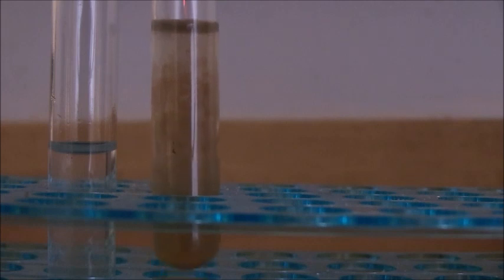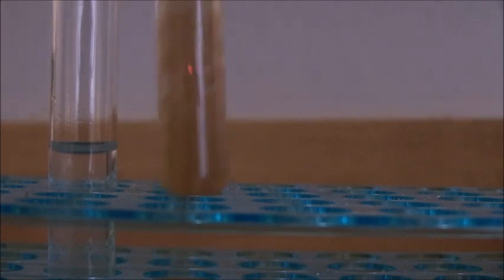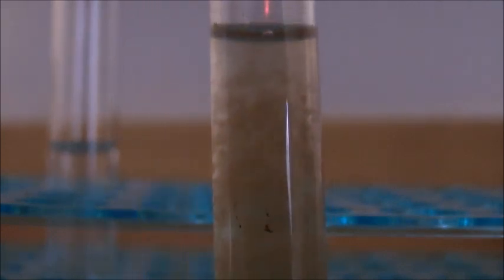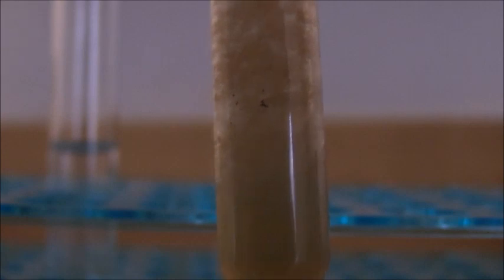So it's been about 15 minutes since the last segment. And so you can see that we have a very pronounced brown precipitate which hasn't settled out. And I think that's due to the difference in density of formamide versus water. But we have a very pronounced brown precipitate.